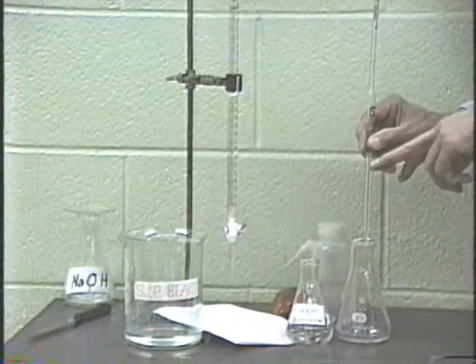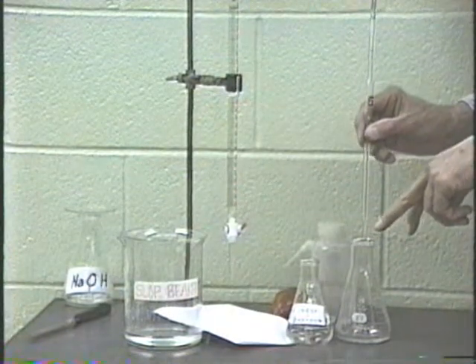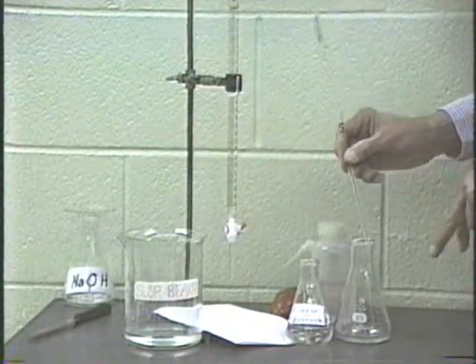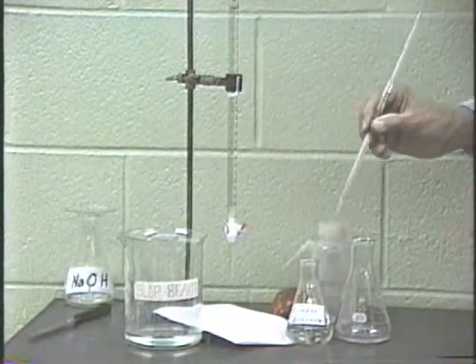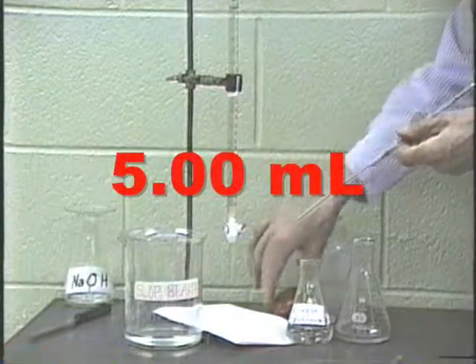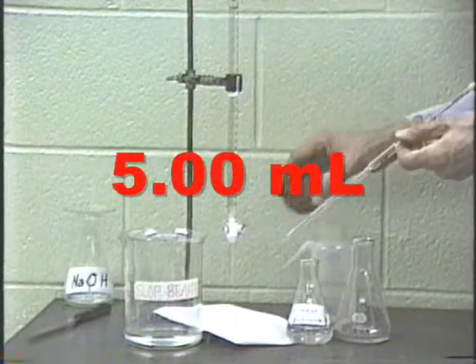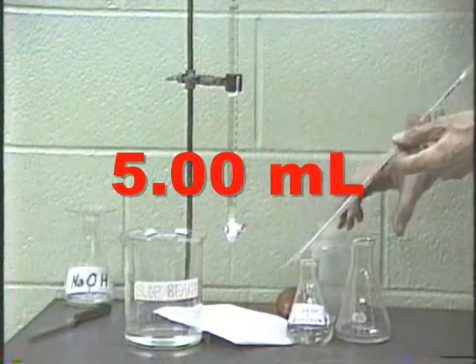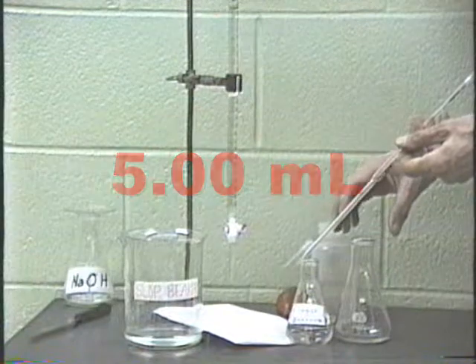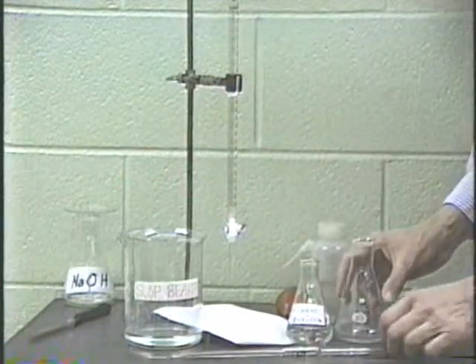Once this pipette now has drained completely, there's a drop hanging from the tip there. Touch it to the side. Whatever comes out, comes out. Do not use the rubber bulb when you're draining out the pipette. The rubber bulb is only used to draw up the liquid or if you're just fooling around. But when you're actually draining out the material here, it should be by gravity. All right, that's the pipette.